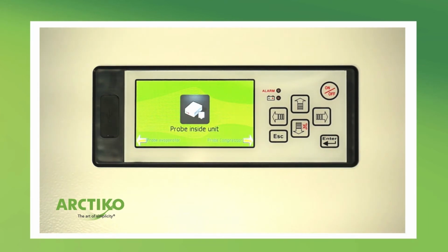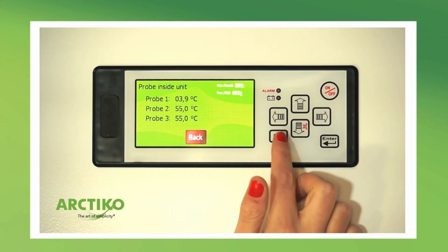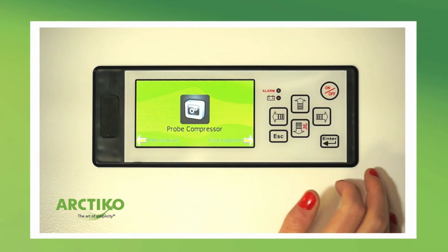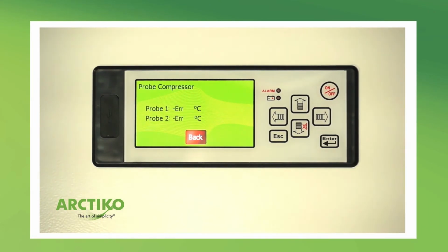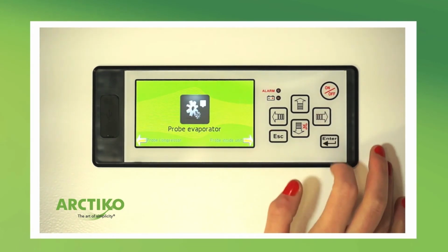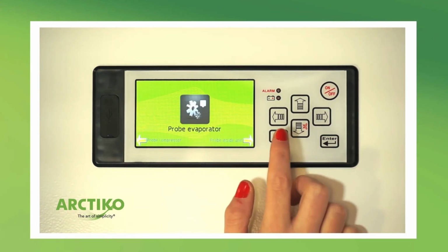Probe inside unit displays the temperature of the sensor mounted inside the unit. One sensor is mounted in the unit as standard. 2 extra sensors can be mounted inside the unit. Probe compressor displays the temperature of the compressor. Probe evaporator displays the temperature of the sensor on the evaporator.